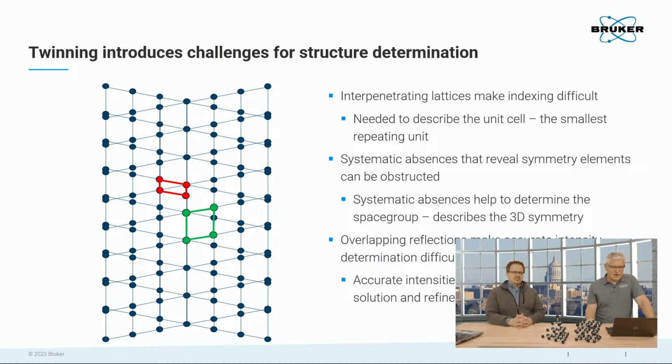cell. You can imagine if you look for the smallest unit cell, which the green one is the right one, when we index, we'll actually find something that looks more like this. And when you repeat this over and over, this will be able to describe most of the spots. So it will be happy with that. But it's not the correct unit cell.